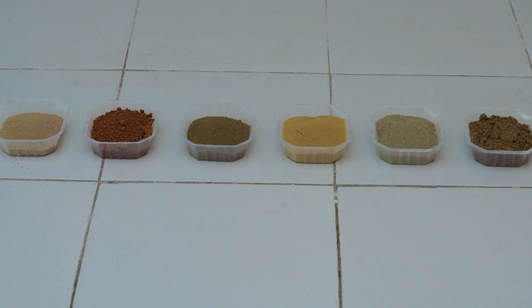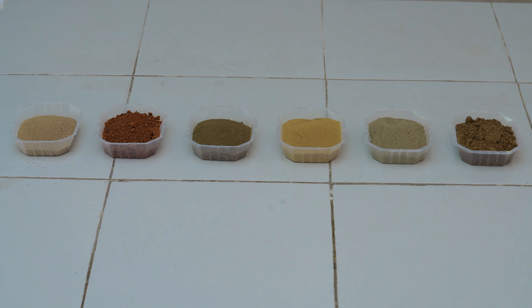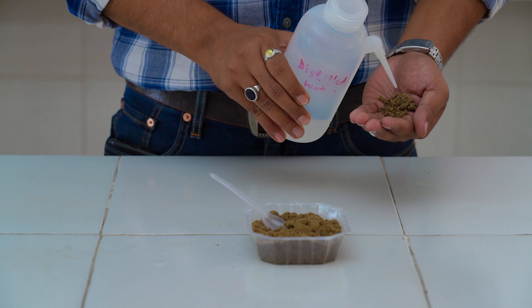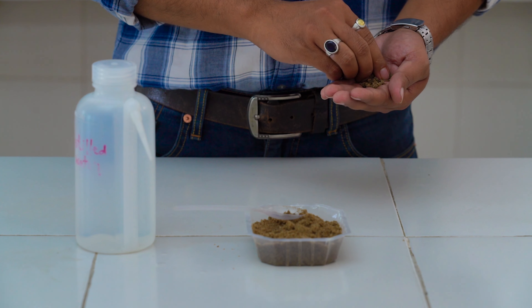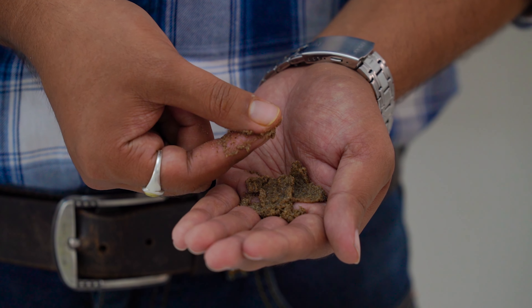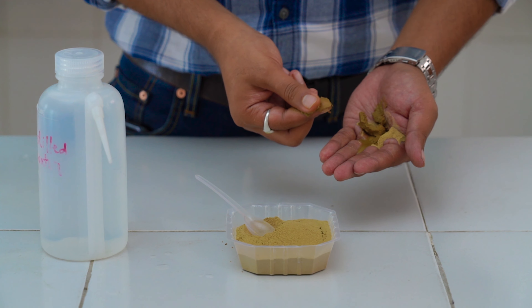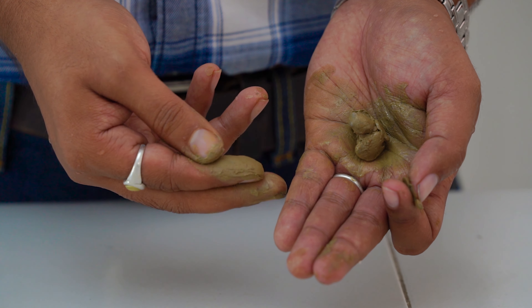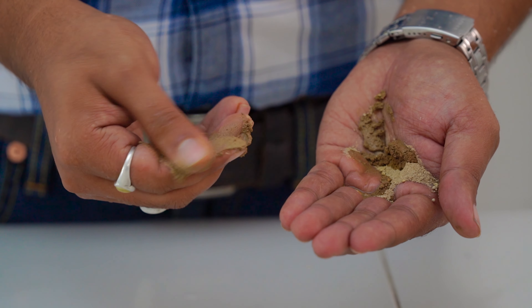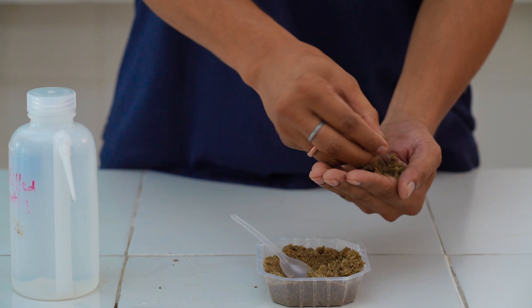Based on these characteristics, soil texture can be determined, though this method is arbitrary and requires skill and experience. Take about 2 grams of soil in your hand and moisten it with a few drops of water. Feel the grittiness or smoothness by rubbing it between fingers. If very gritty: sand or loamy sand. Moderately gritty: sandy loam. Neither very gritty nor smooth: loam. Smooth or sticky, buttery feel: silt loam. Slightly gritty: clay loam. Very smooth: silty clay loam or clay.